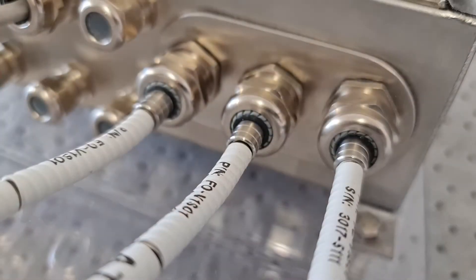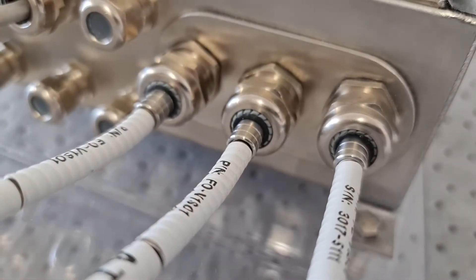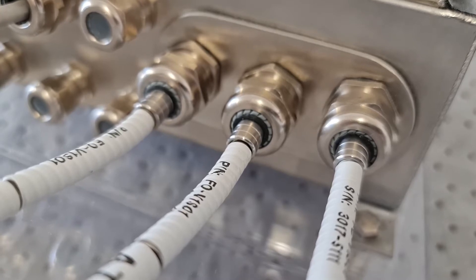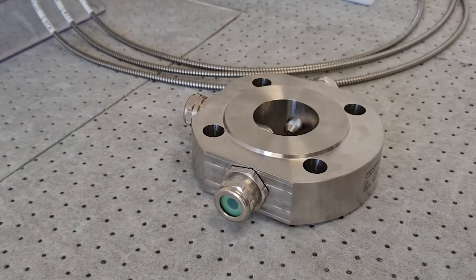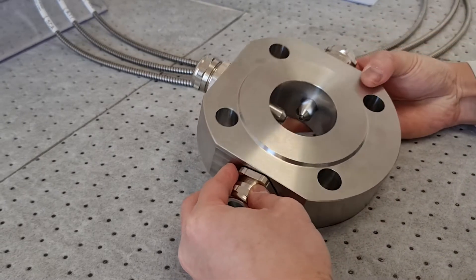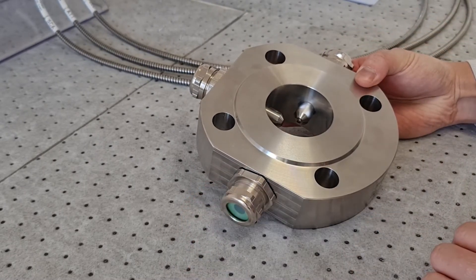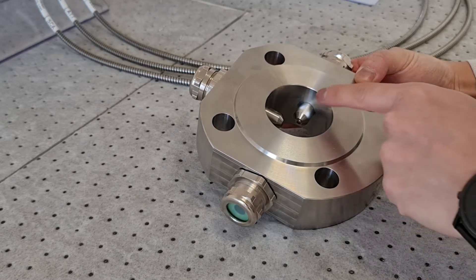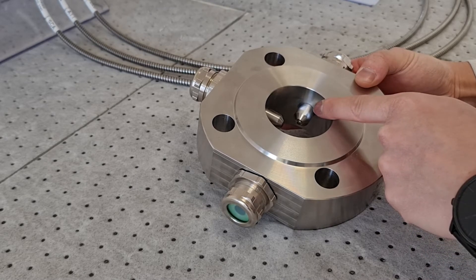It is important to ensure that all the cable glands are firmly and tightly fastened to the fiber optic cables. Now we are going to connect the fiber optic cables to the measurement cell. The sapphire glass windows are protected by the metal measurement ports that protrude into the flow of sample.